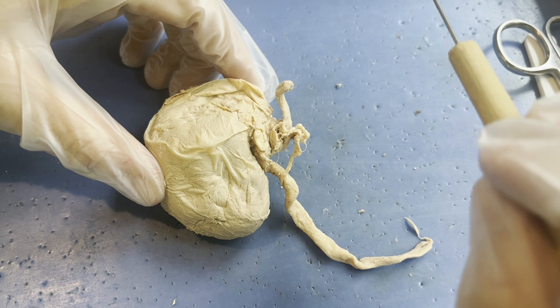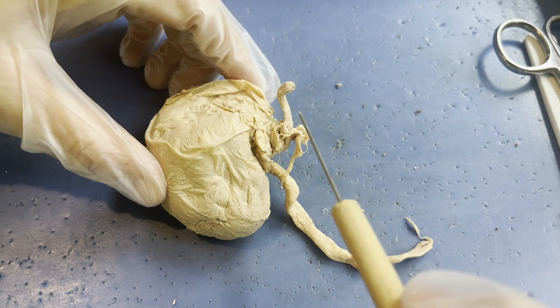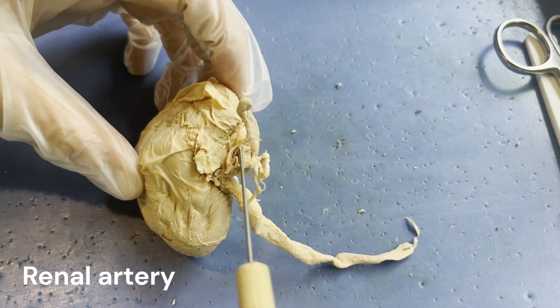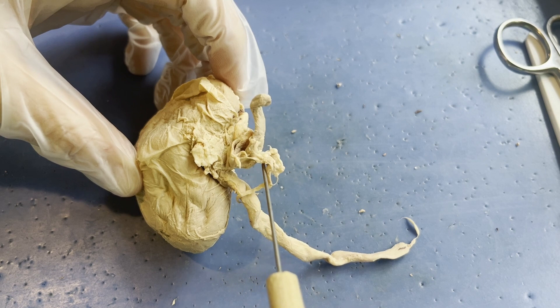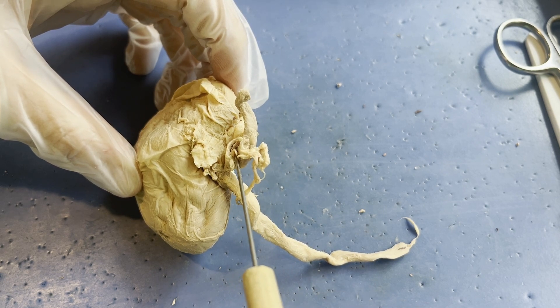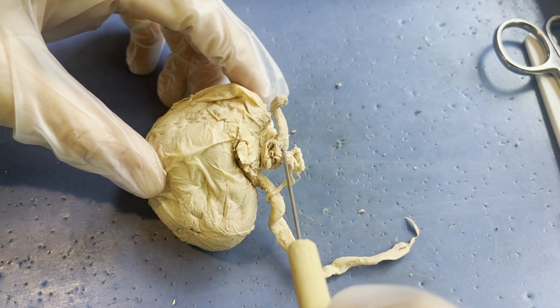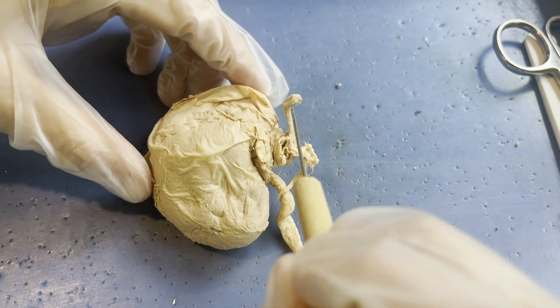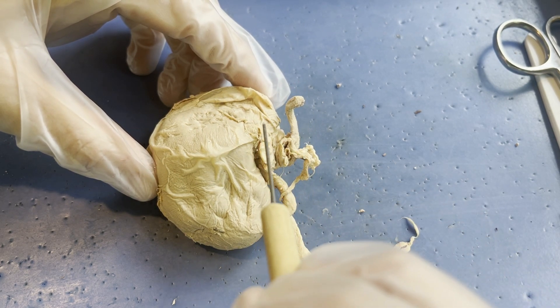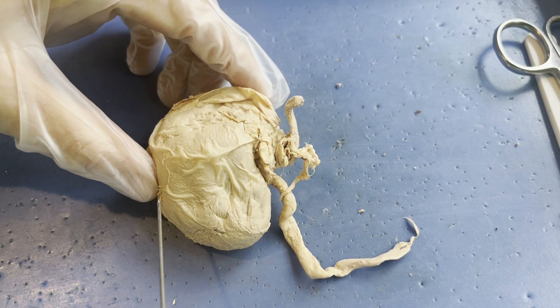Oxygenated but unfiltered blood arrives at your kidney through your renal artery. I'm not exactly sure which blood vessel in this bundle is the renal artery versus the renal vein — I believe I see a blood vessel here and a blood vessel here — but let's say this is our renal artery. This oxygenated but unfiltered blood comes to the kidney, and that unfiltered blood travels through the internal system of our kidney, which we'll look at in a few moments.